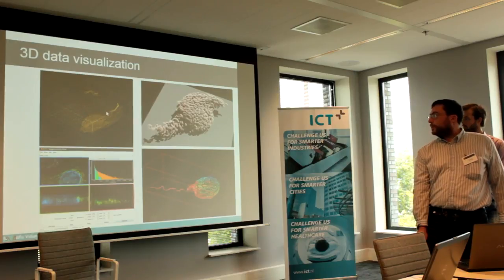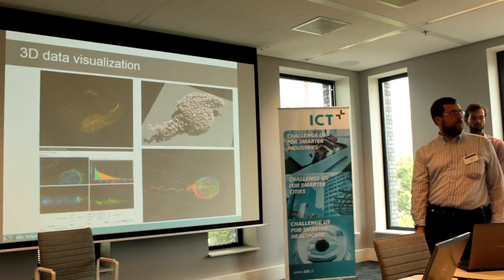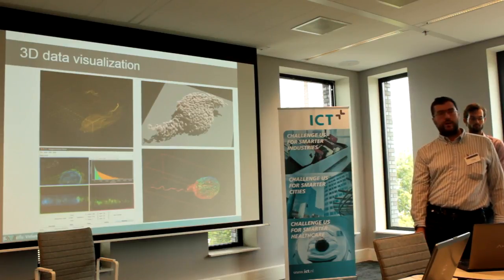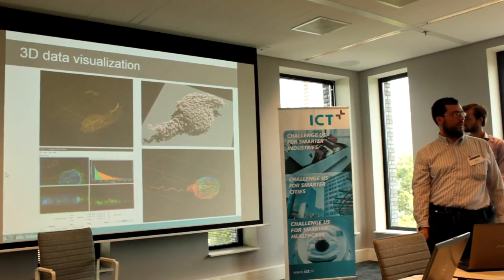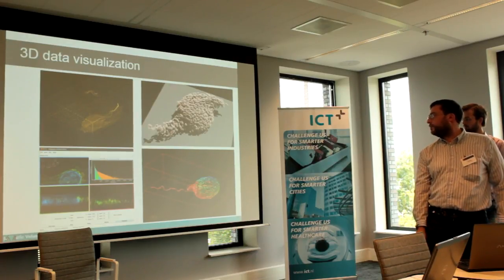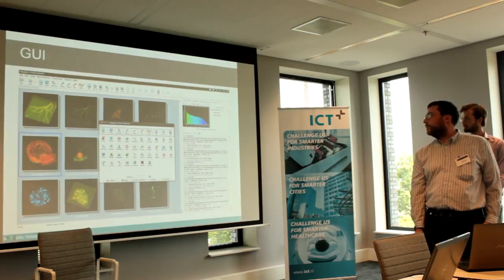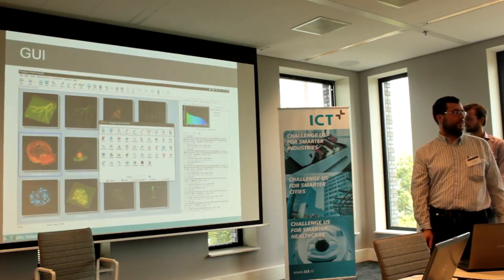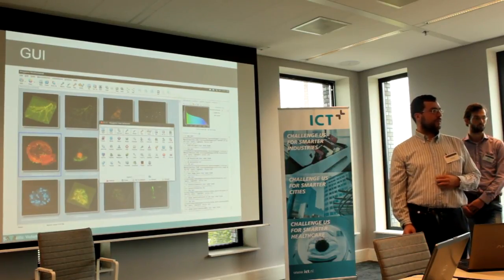So here you see a maximum intensity projection way of visualizing the data. This is a special way of visualizing that emulates what happens with a fluorescence process. Here you see 3 orthogonal slices through the 3-dimensional data set. So there are different ways to visualize data. This is a part of what the user interface looks like. So you will recognize a lot of TK, because basically everything is made with TK.